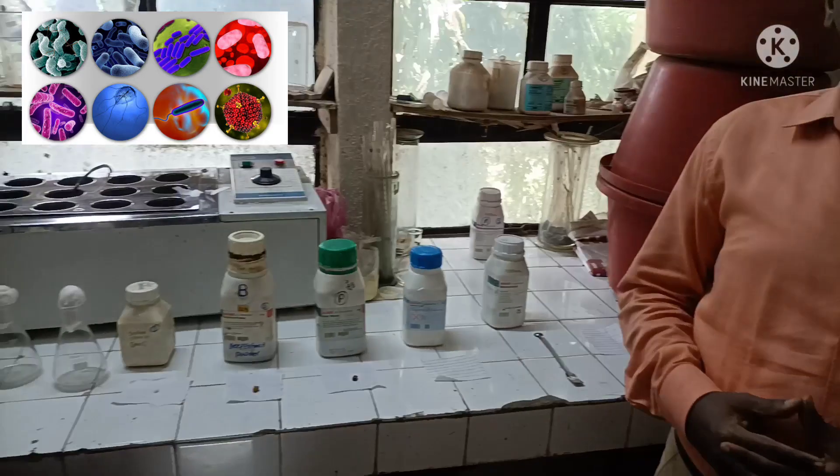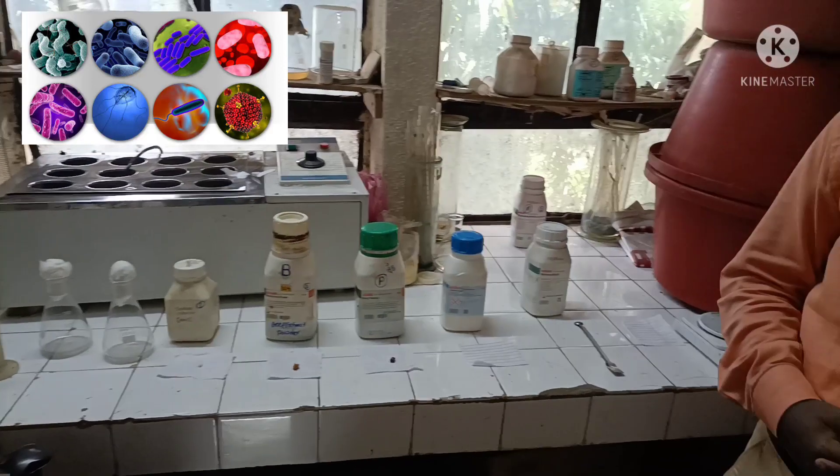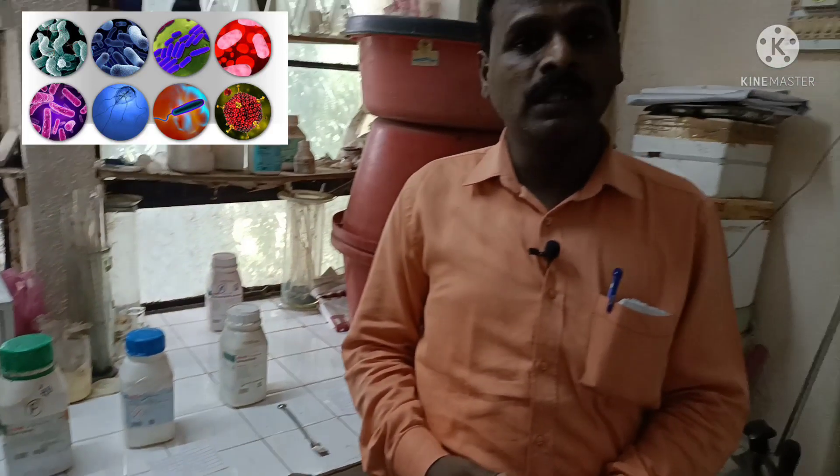Microorganisms need carbon sources, nitrogen sources, and various elemental requirements. We have to supplement and provide all these essential ingredients so that the microorganisms will grow by utilizing them, and then we can grow these microorganisms in the laboratory.